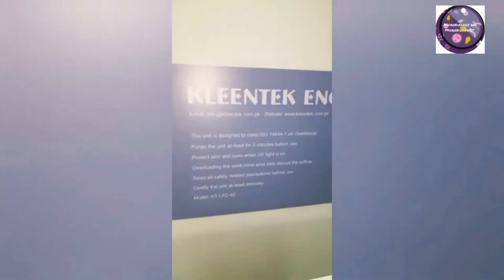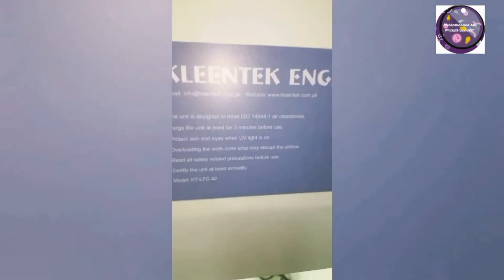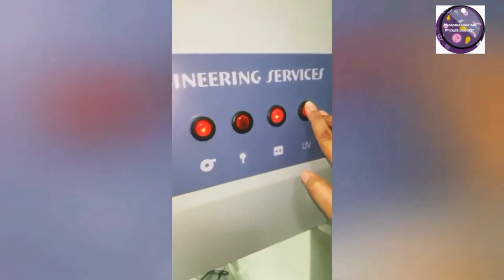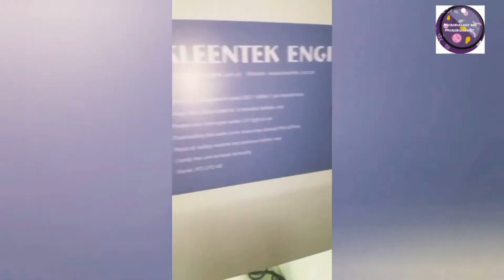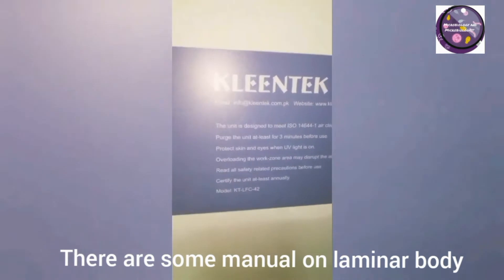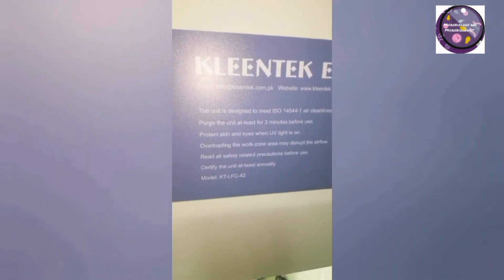This laminar airflow hood doesn't have UV light, because there is no requirement for pharmaceutical non-sterile products testing, and even not for sterile. The UV button you see here is used for normal electric light.